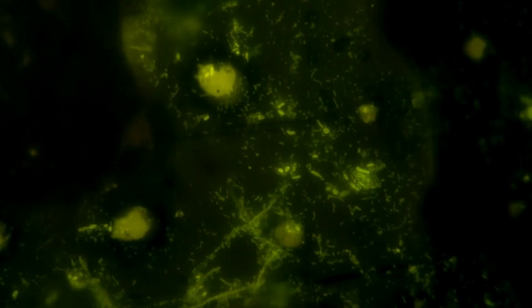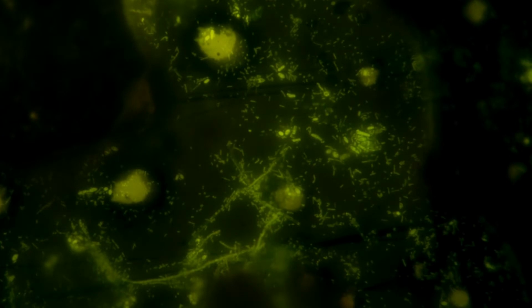So these also consist of platelets. These platelets actually consist of mycotoxin, these tiny platelets. These actually form the tubercules, and tuberculosis forms the citra fibbrata. Now you can see the fibbrata. The more tuberculosis are visible here, you can see the absolute, clear picture of the tuberculosis.